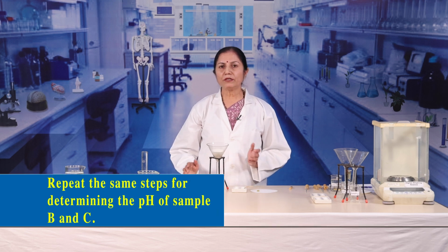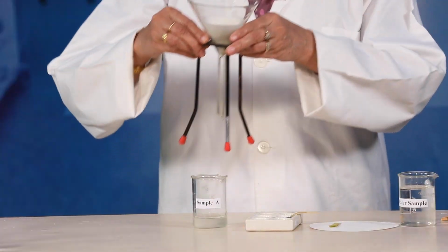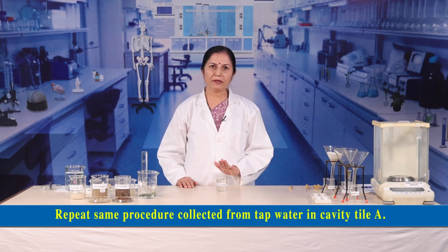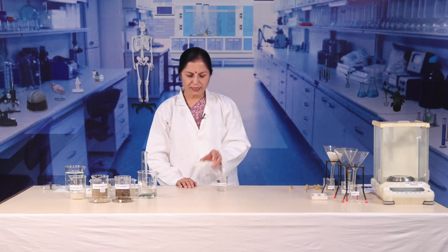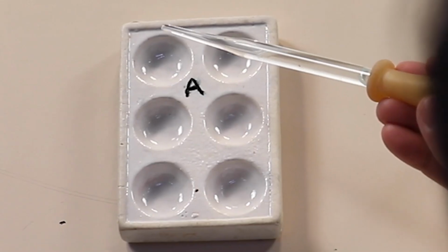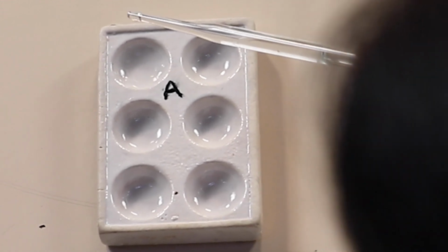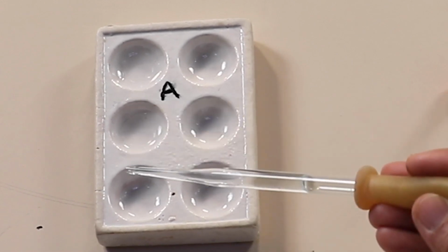Repeat the same steps for determining the pH of soil sample B and C. Follow the same procedure for the water sample collected from tap water. Note the pH of the water sample in the same manner. Collect 5 drops of water and put it in the first cavity. Similarly, in the second and third cavity.